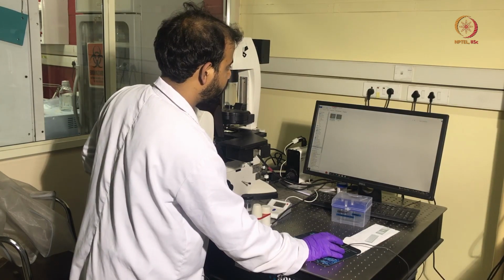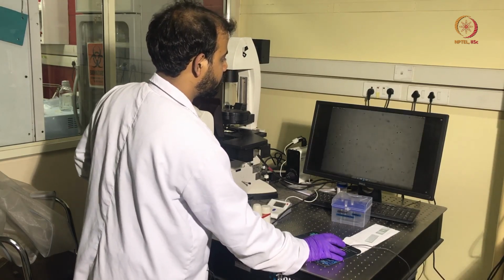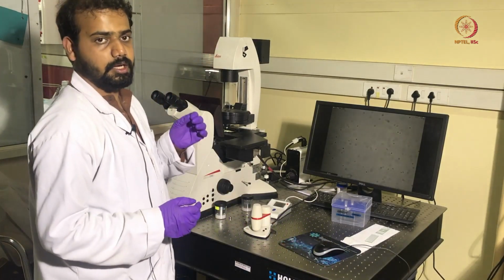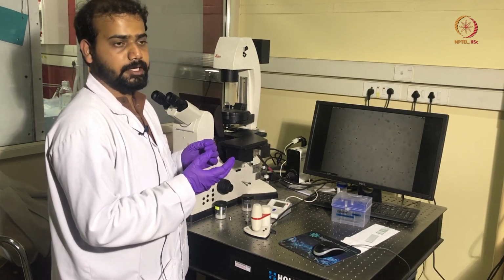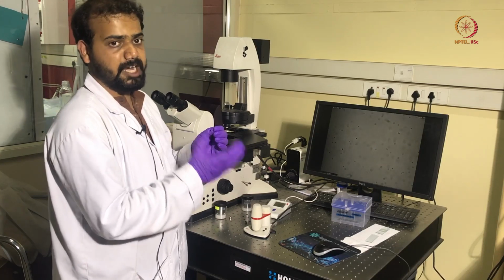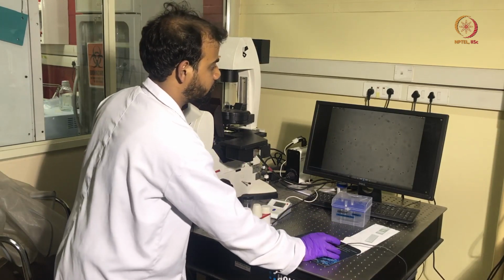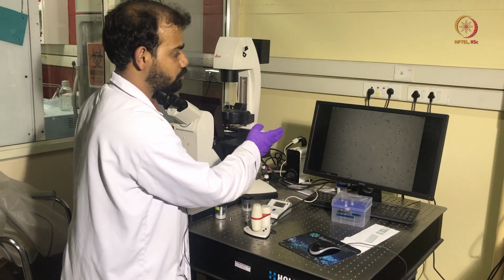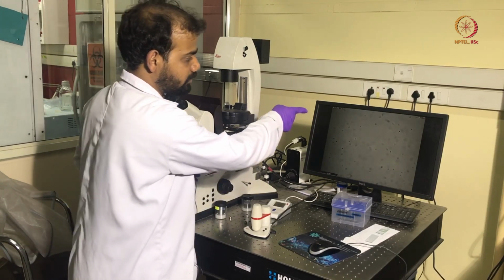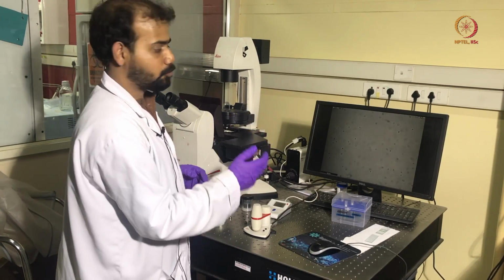This is the bright field video which we just witnessed. In bright field microscopy, the particle absorbs the light and creates a contrast from the background by creating a dark image in a bright background. This is the concept of bright field microscopy. And here you can see the colloidal particles undergoing Brownian motion using bright field microscopy. The dark images are the Brownian particles, and the background is bright. That's why it is bright field microscopy.